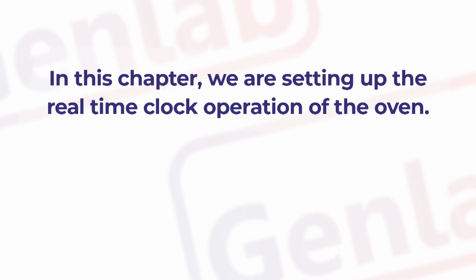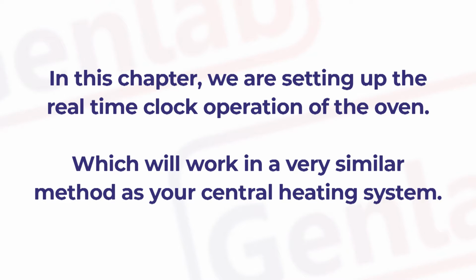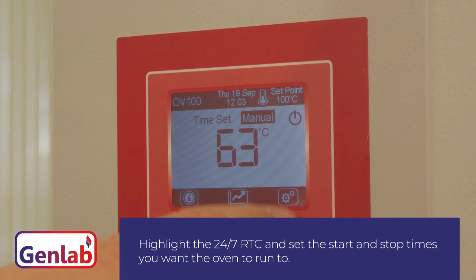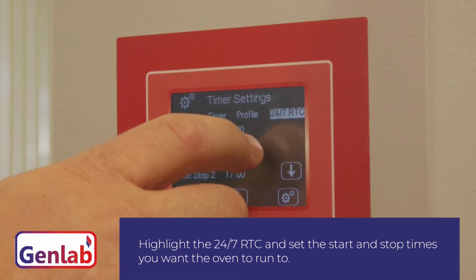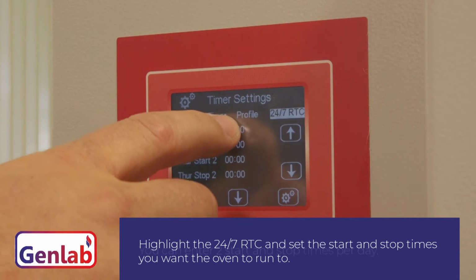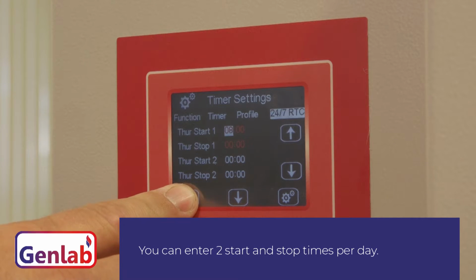In this chapter, we are setting up the real-time clock operation of the oven, which will work in a very similar method as your central heating system. Highlight the 24/7 RTC and set the start and stop times you want the oven to run to. You can enter 2 start and stop times per day.